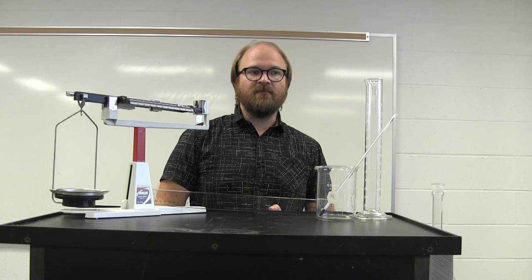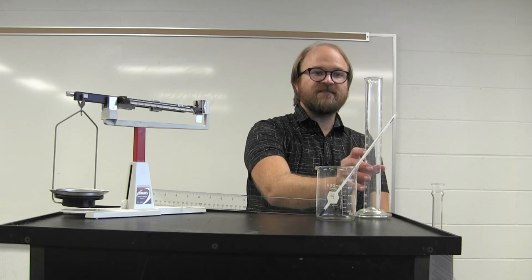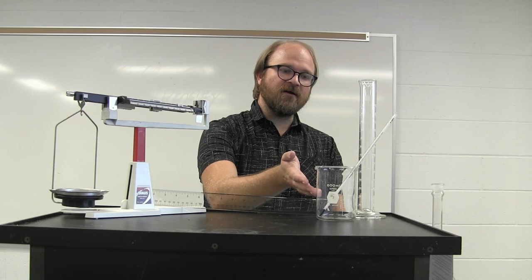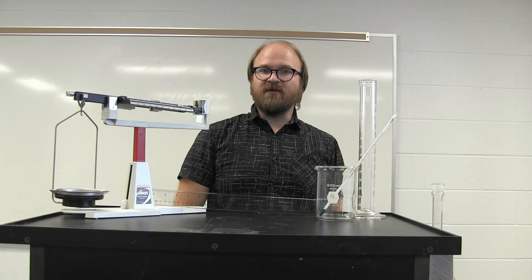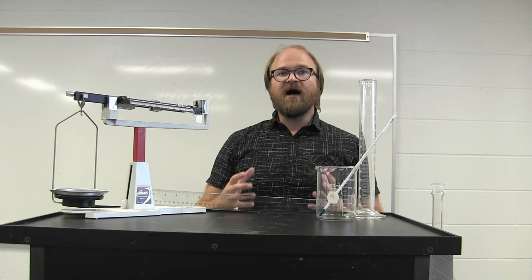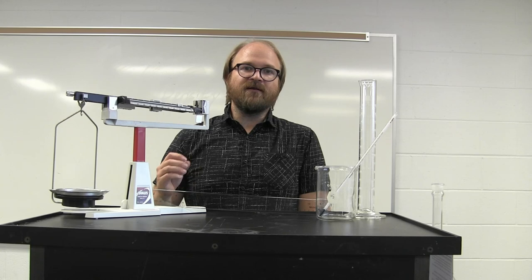Many times there are separate pieces of equipment used for the same measurement. In the case of volume, you can measure things very precisely with a narrow graduated cylinder, or very generally and imprecisely using a beaker. A beaker should never really be used for volume measurement as it's very inaccurate. This experiment focuses on measuring different individual components and then using those to calculate the measured and calculated property of density.